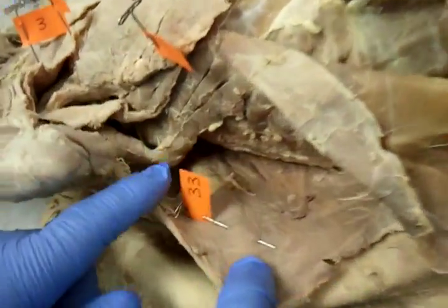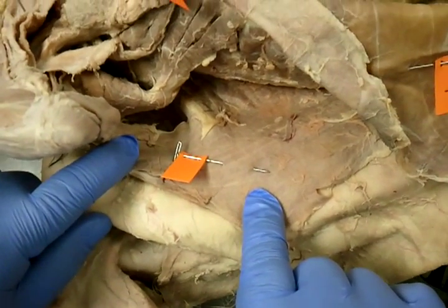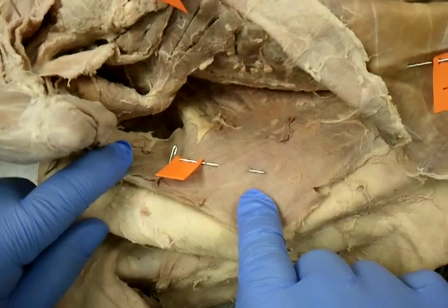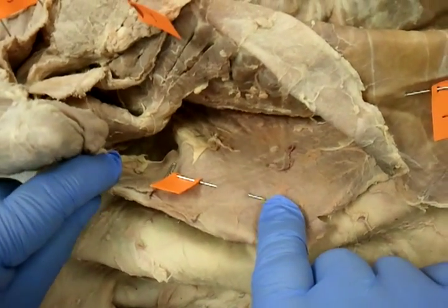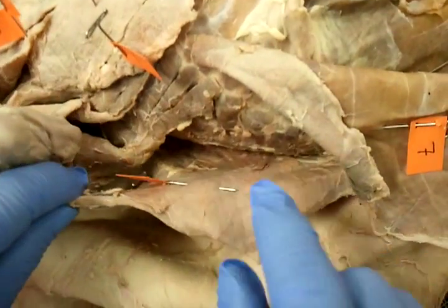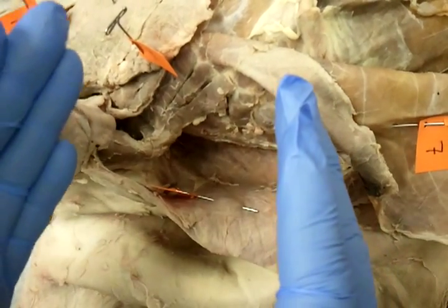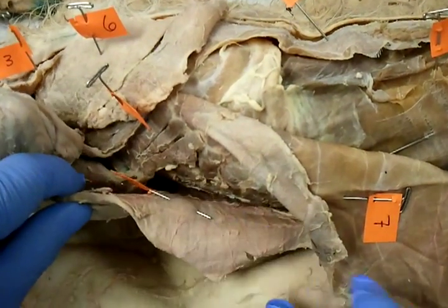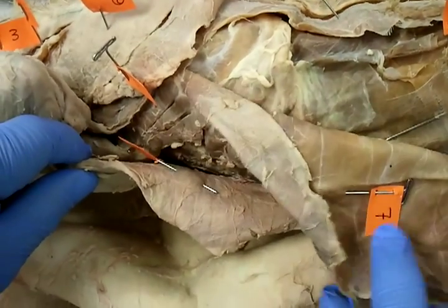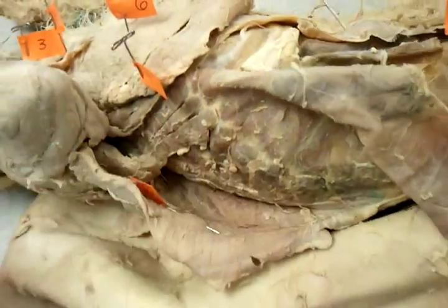Number thirty-three is latissimus dorsi. That's located in between where the arm and elbow end and the stomach begins — different layers. Here's number seven and here's number thirty-three.